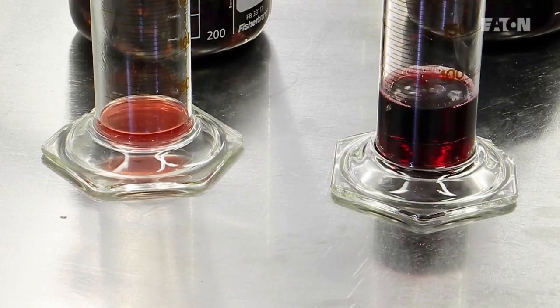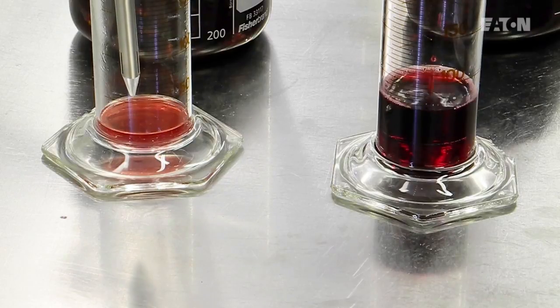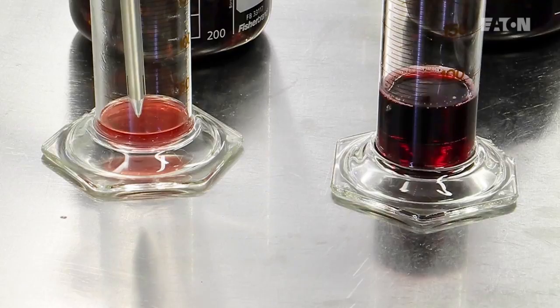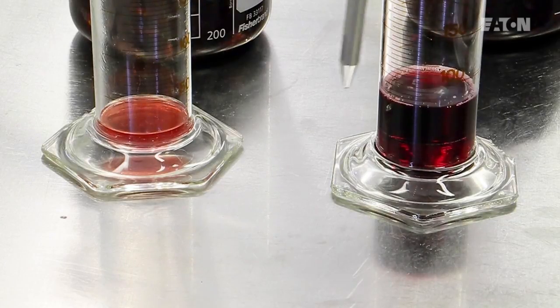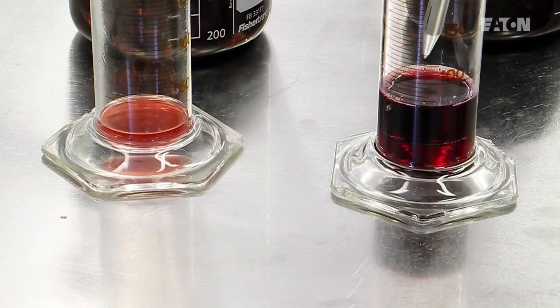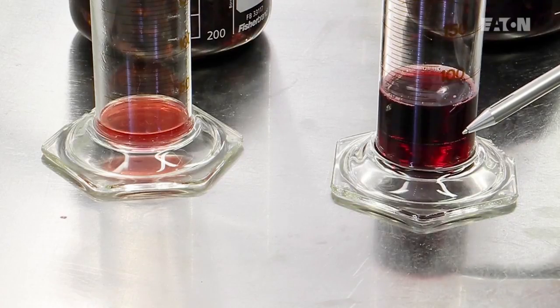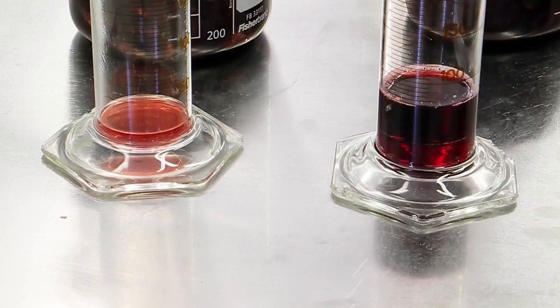The result of the drop test can be seen here. In the trial without enzyme, there is only a small liquid fraction — only a small volume of free-run juice. On the other hand, with enzyme, we have a much higher volume of free-run juice. The color is much more brilliant and it is a really dark color. This is the most significant benefit of an extraction enzyme.